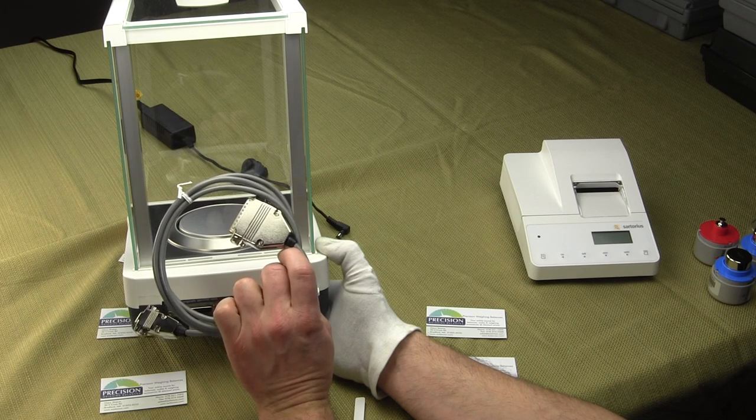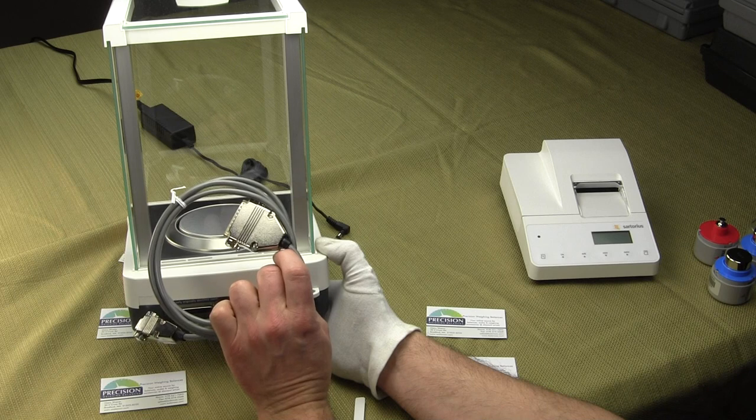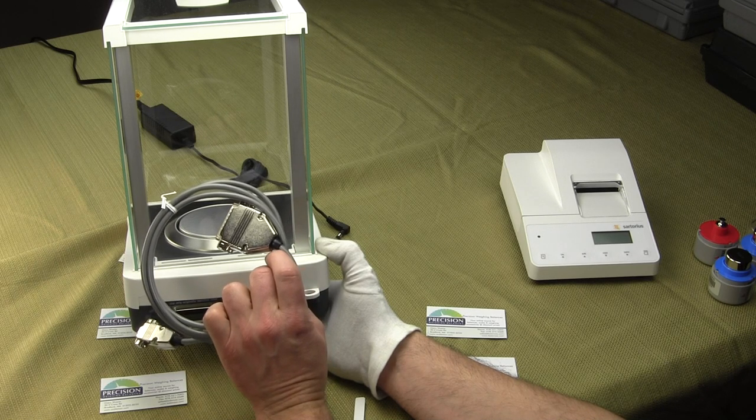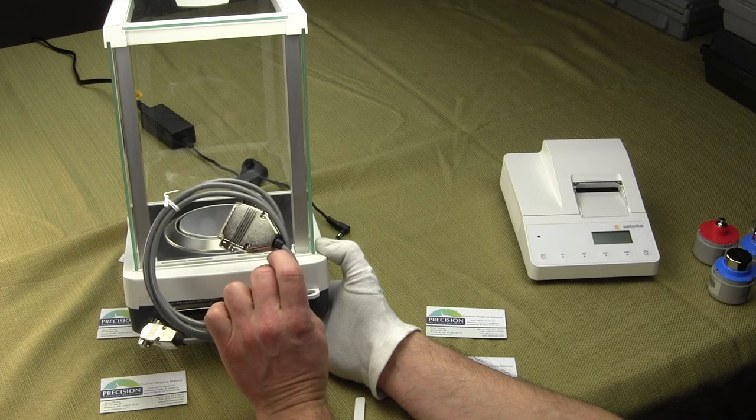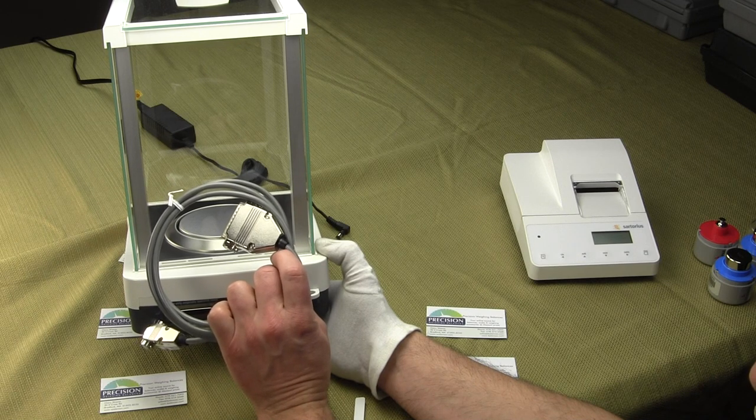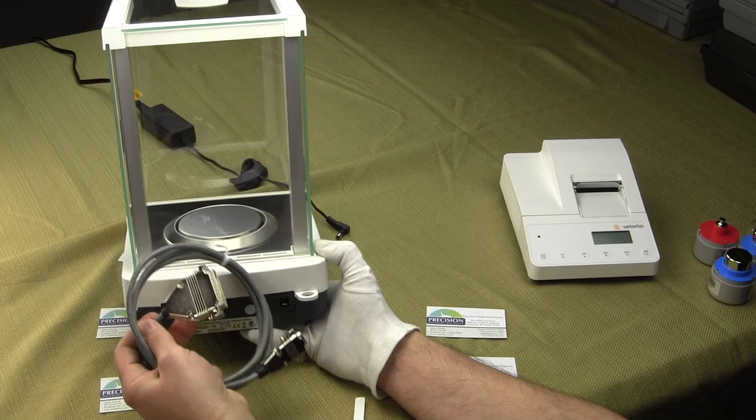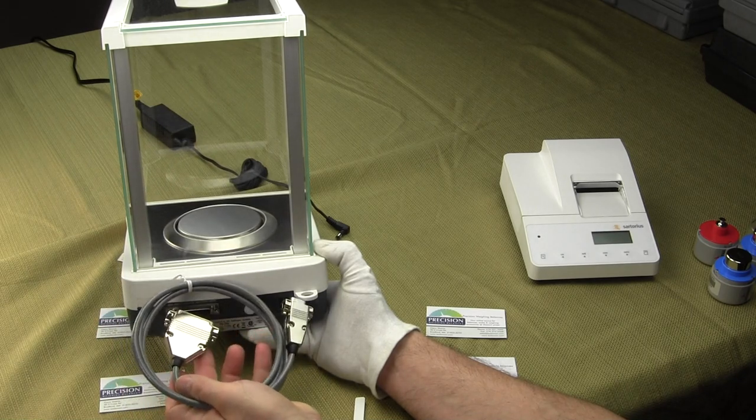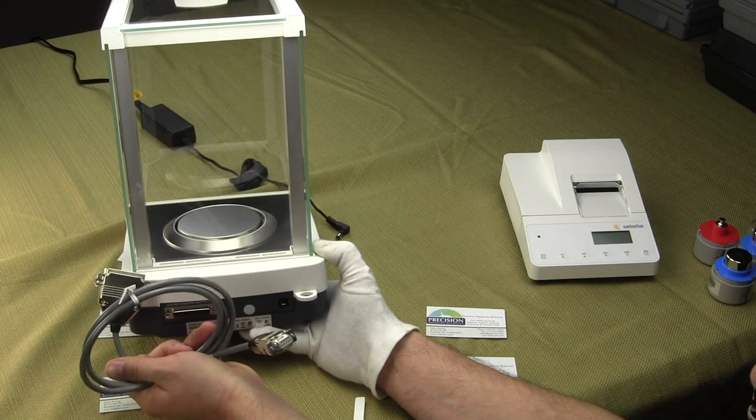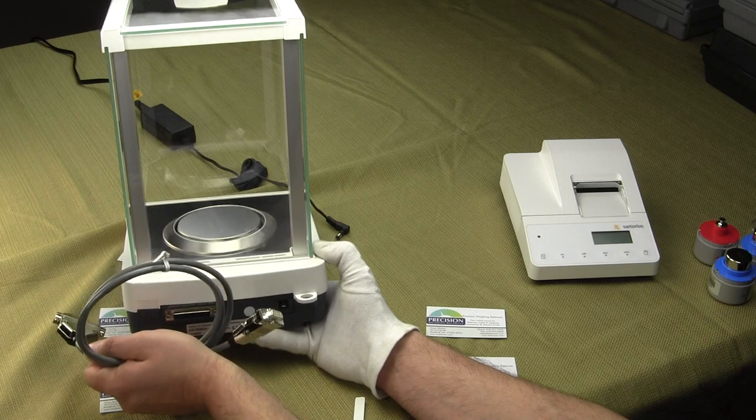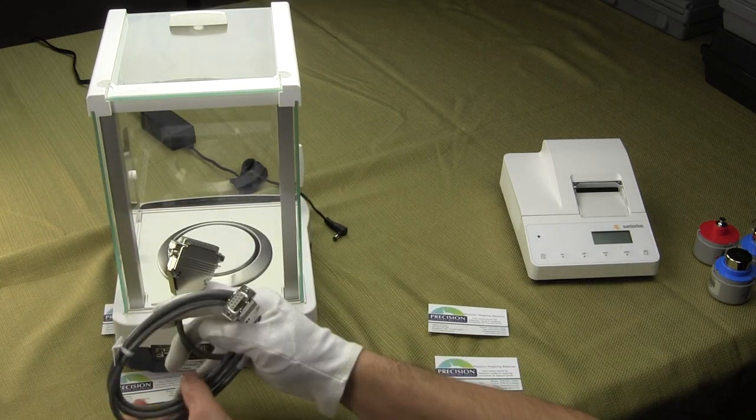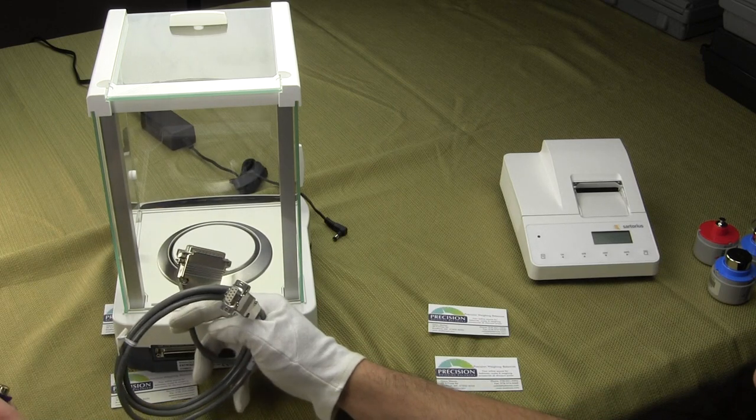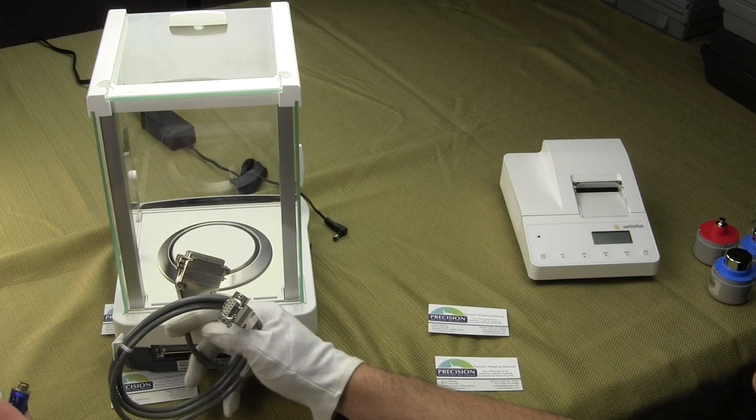I would highly recommend you buy the cable. If you want to make your own cable, you can refer to the user manual, which explains the pinout. But this is not a standard cable you could find in a computer store. The 25-pin plugs into the balance. On the other end is a 9-pin that would go to your computer. But most computers do not have a serial interface.